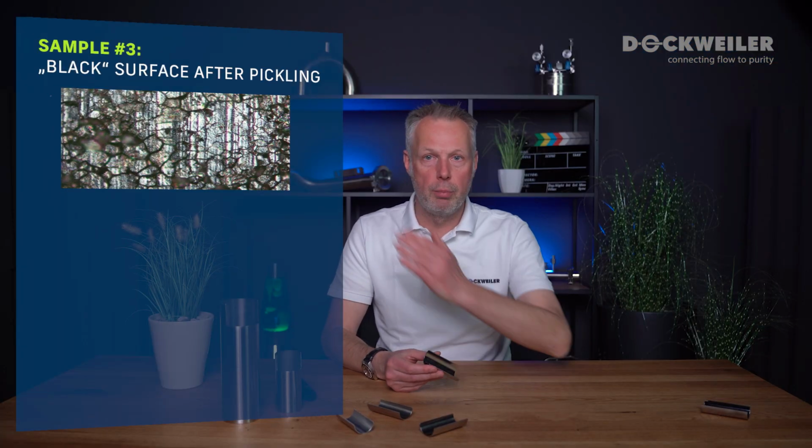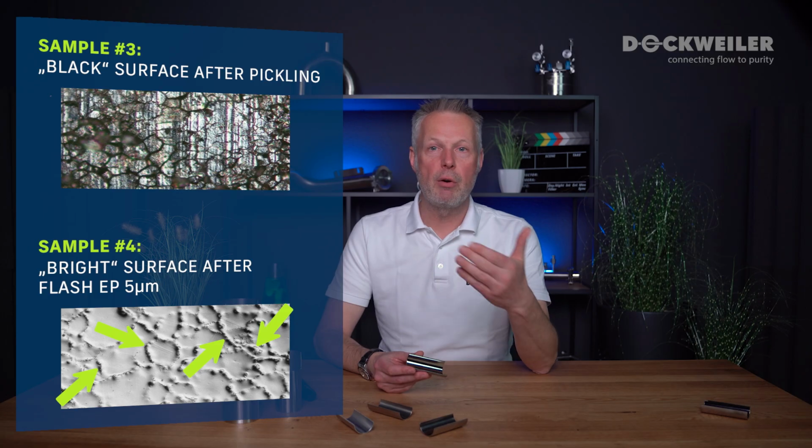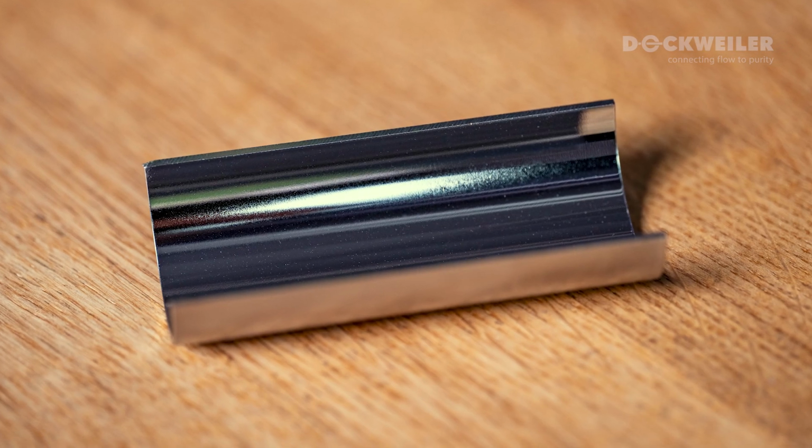When you look at it on a microscope, you still see the grain boundaries very visible. I wouldn't say it's the same as with the pickled one, but you still see these grain boundaries very well. And why does that happen? Because the material there has a lot less corrosion resistance, probably that's the better term, compared to the other material. That's why the electrolyte and the attack of the current goes deeper into the material at these grain boundaries than on the grain, where you don't have that much chromium carbide, right?